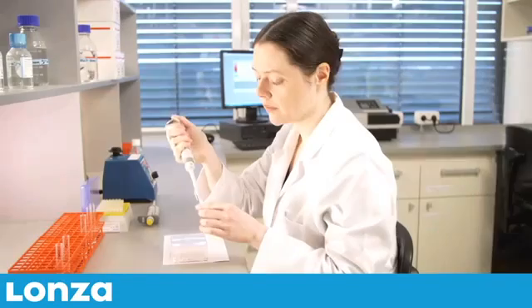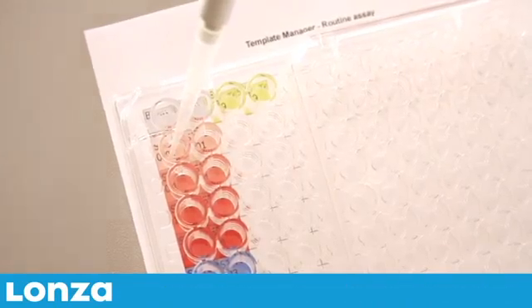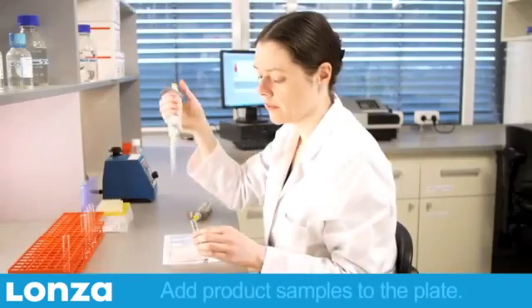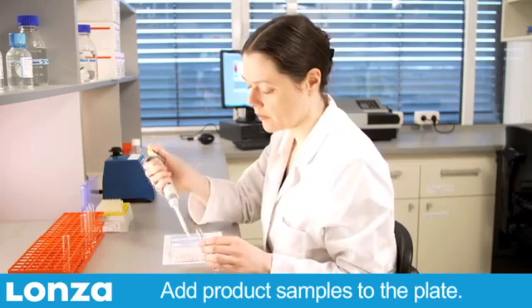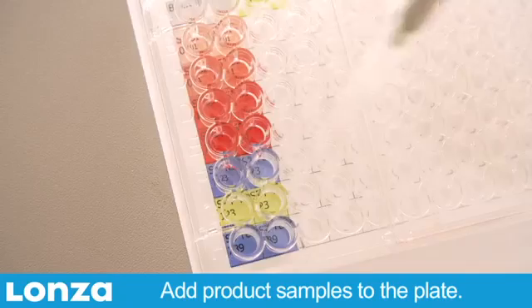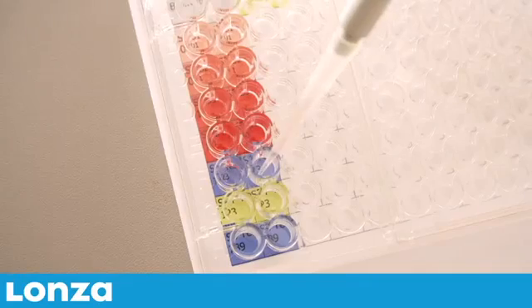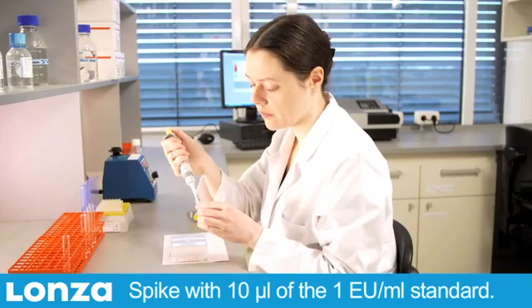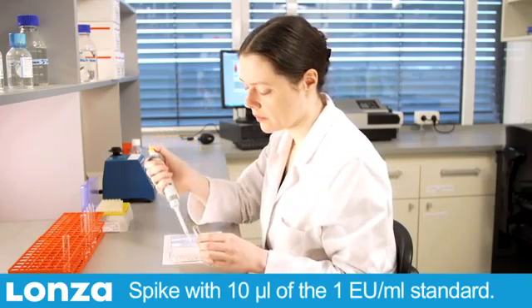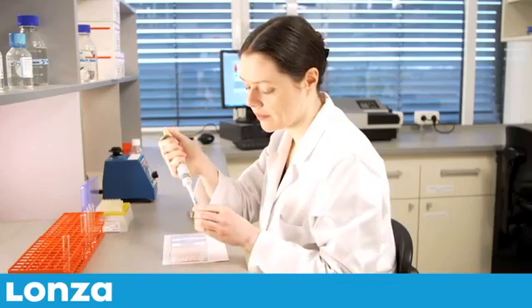Add LAL reagent water blank and endotoxin standards to the microplate. Next, add 100 microliters of product samples to four wells. This allows for the testing of both the sample and the sample plus a PPC in duplicate. To generate positive product controls, transfer 10 microliters of the 1 EU per milliliter standard to the PPC wells. Between 50 to 200 percent of the spiked endotoxin should be recovered.